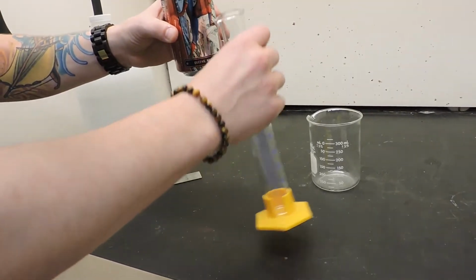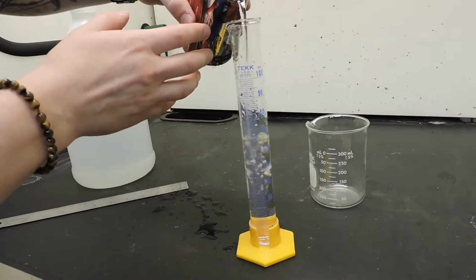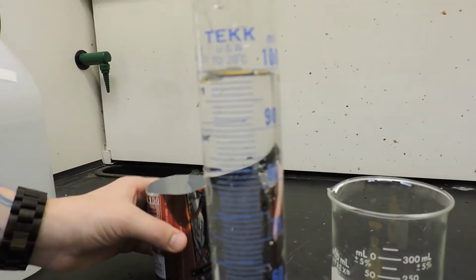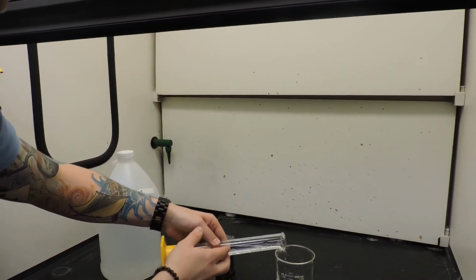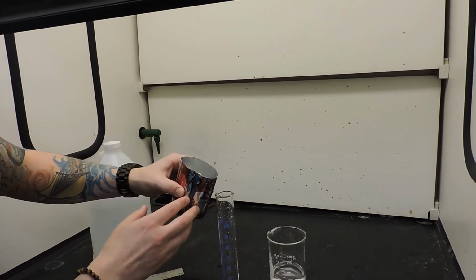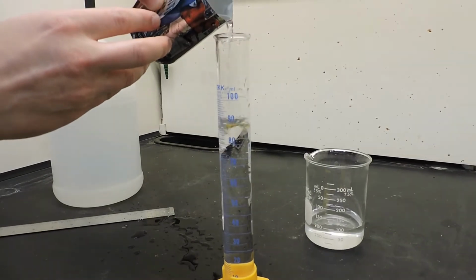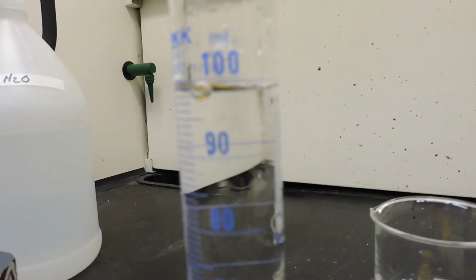Note any sources of error that may occur as you pour the liquid into the container, such as spilling. Remember to interpolate between the lines when measuring the volume inside the graduated cylinder, and to read the bottom of the meniscus.